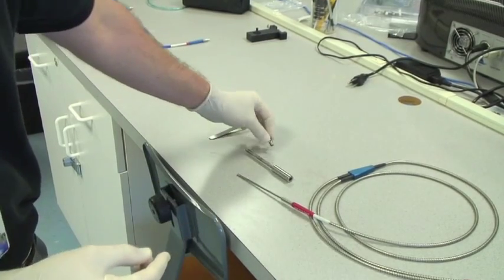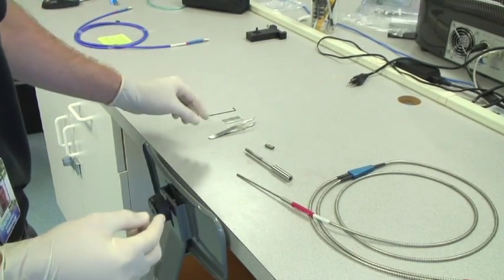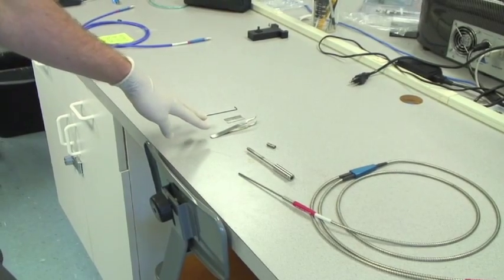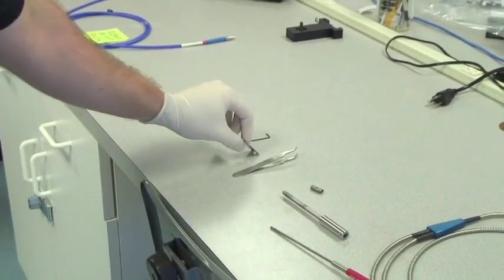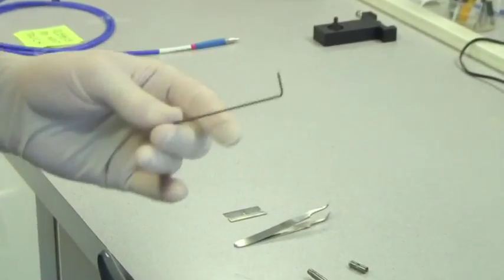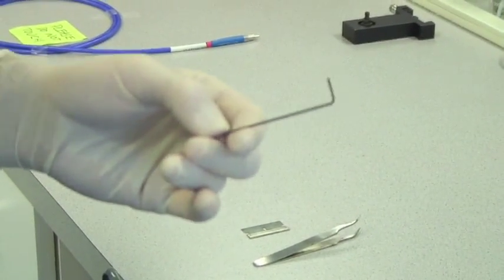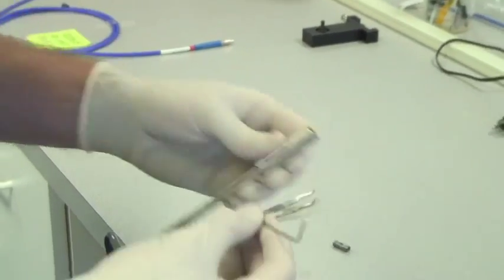Three of the tools that are very useful for this are a pair of tweezers, a razor blade, and a 0.05 inch allen key. This is used to secure the set screws on the side of the T300 main ferrule.